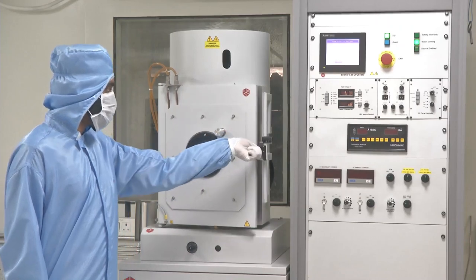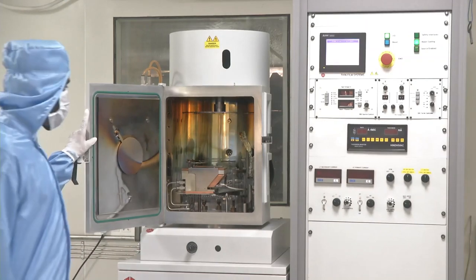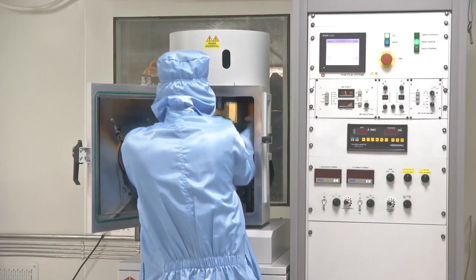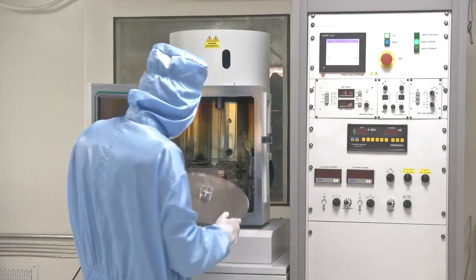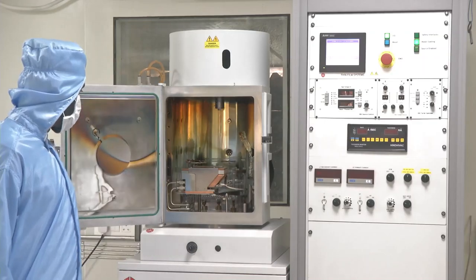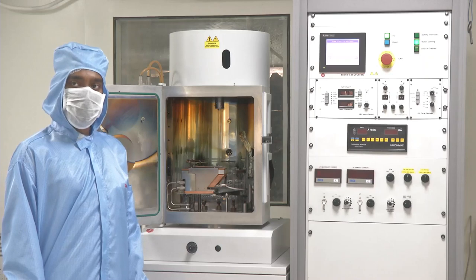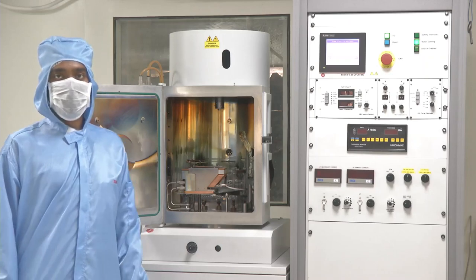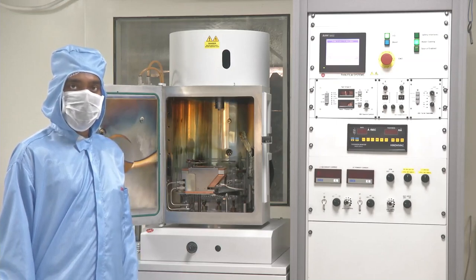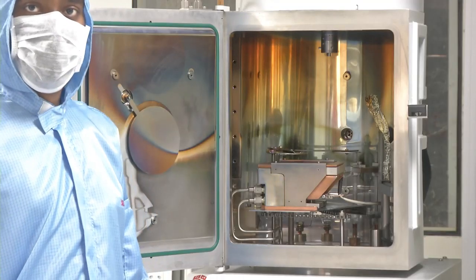This is how we open the chamber. After opening the chamber, the next step is to unload the chuck. Chuck is another name for substrate holder. The substrate here can be a silicon wafer, glass wafer, or any other kind of substrate such as glass slides on which we would like to deposit the material. Now let us look at what exactly is inside an electron beam evaporator vacuum chamber.